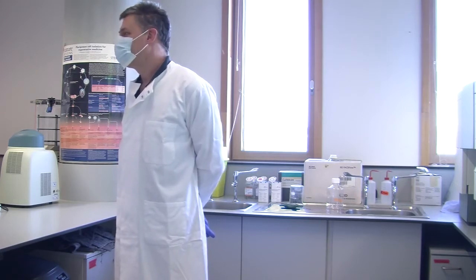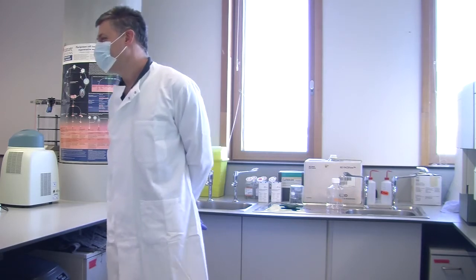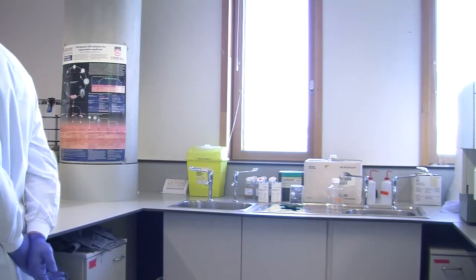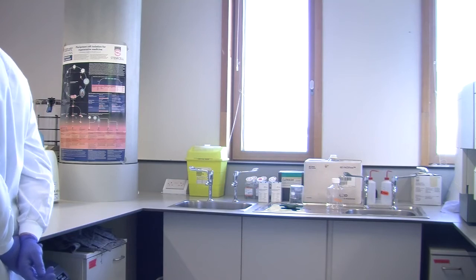Someone's going to have to go and make this one. Bloody four corners. No, that's fine. We'll manage it. Well, as long as they're all labelled, that's the thing.